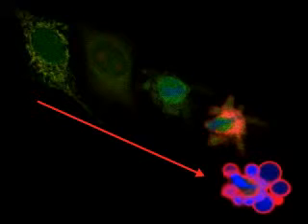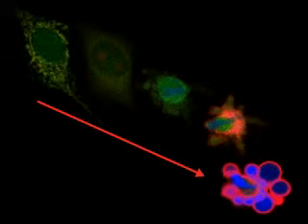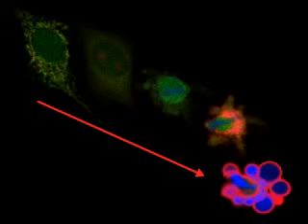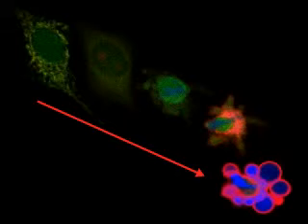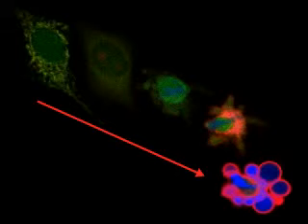The mechanism of apoptosis involves many tightly controlled steps, three of which are visualized here by different staining techniques.